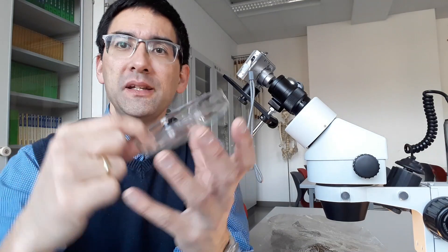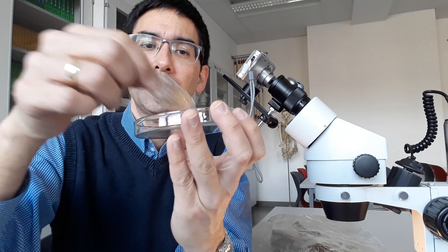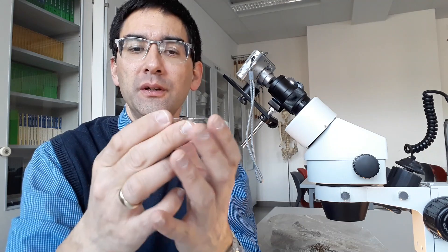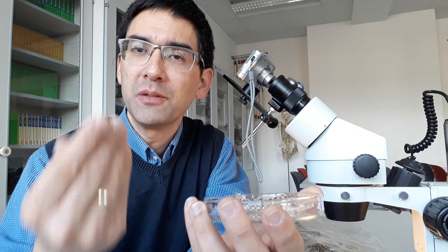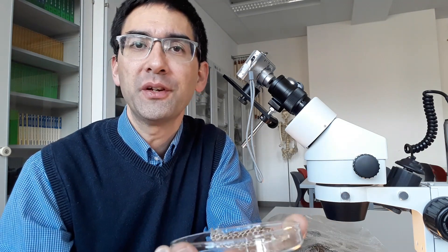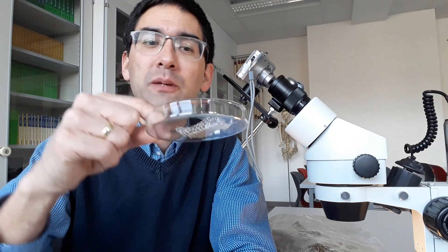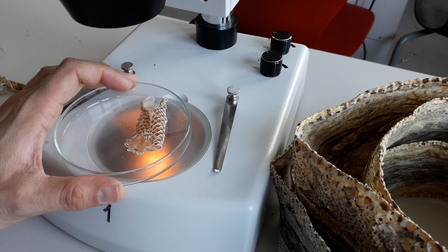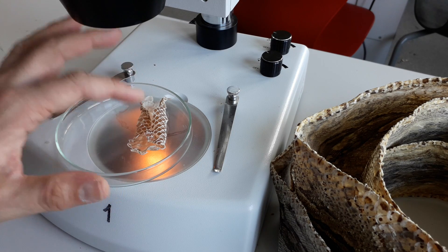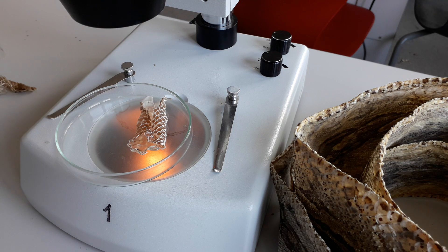Often it's better to place the specimen directly on a petri dish because it's easier to move around. This way you don't have to touch it, which is important because some specimens are delicate. There might also be grease, dirt, bacteria, or other infectious material that you don't want transferred to your skin. Petri dishes like this are highly recommended. It should go without saying that you should not work with infectious materials in the first place - make sure specimens are completely dry and not decaying.